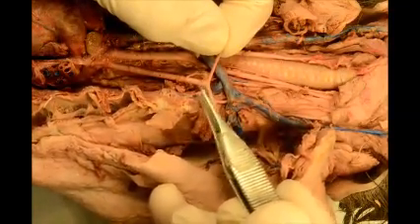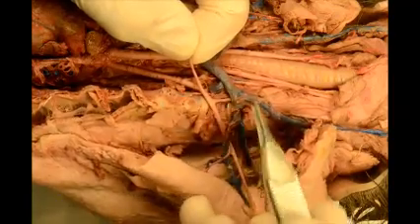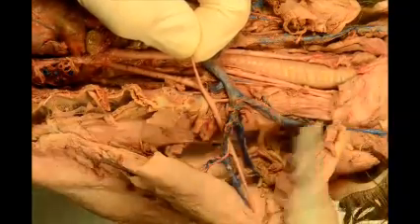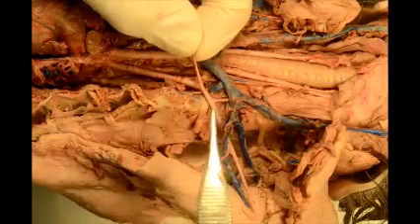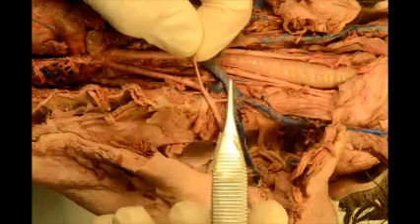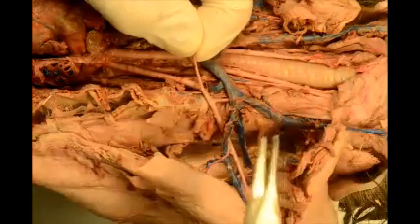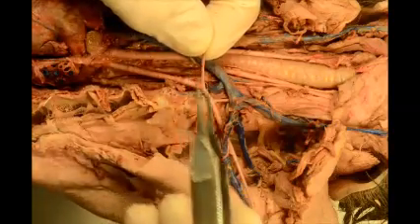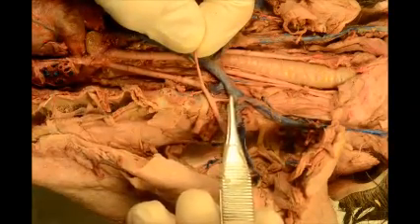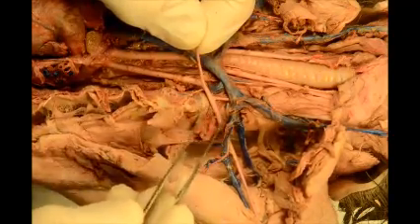T is thyrocervical, which is here. If you look at the direction, it's going towards the thyroid. The name indicates it's going towards the thyroid gland, and cervical means neck. So that's the VCT. Now once you get past the T — which is again the thyrocervical — you now have the axillary.